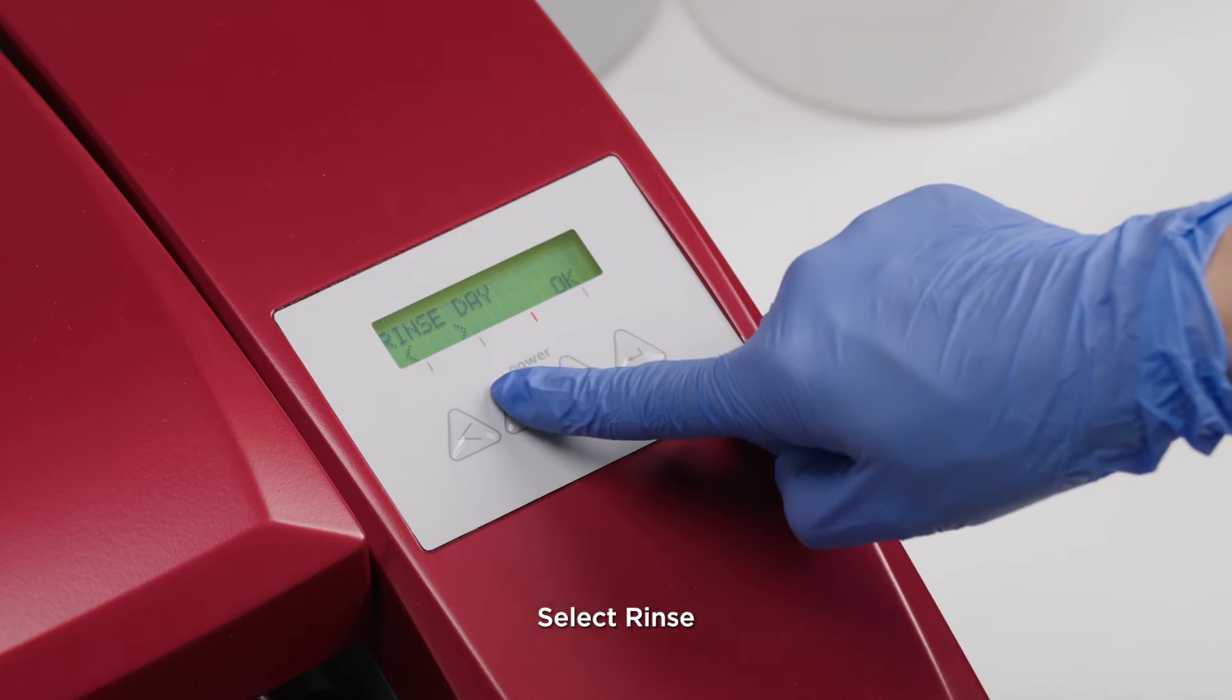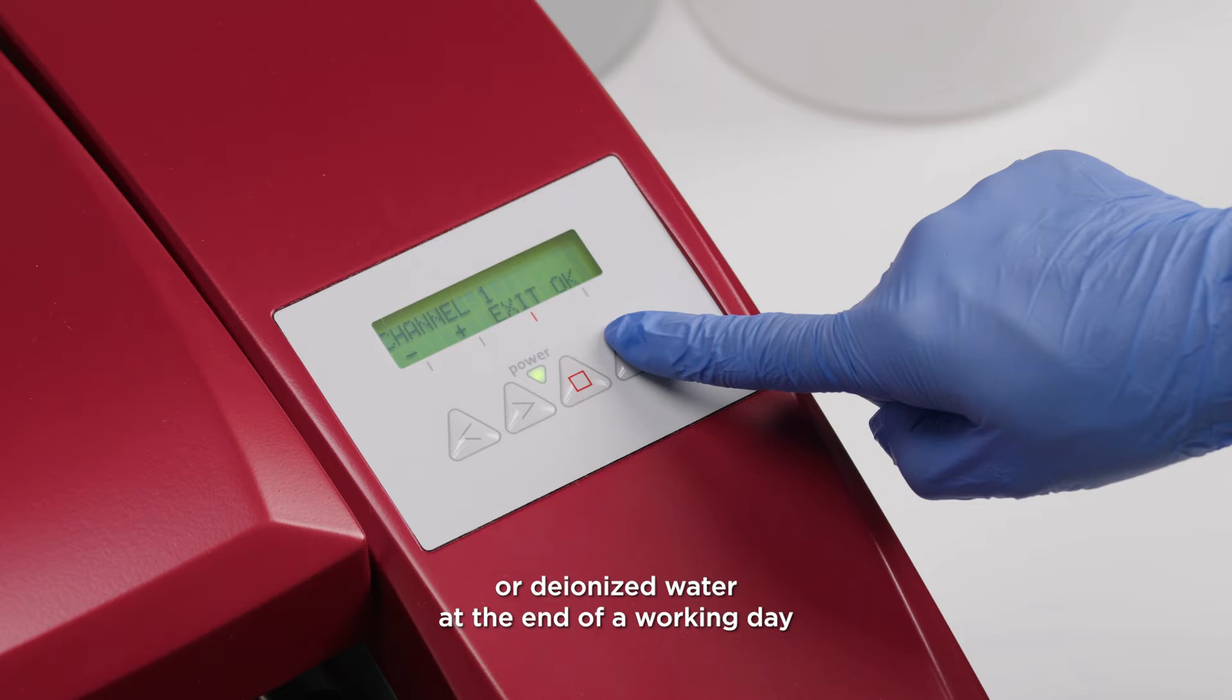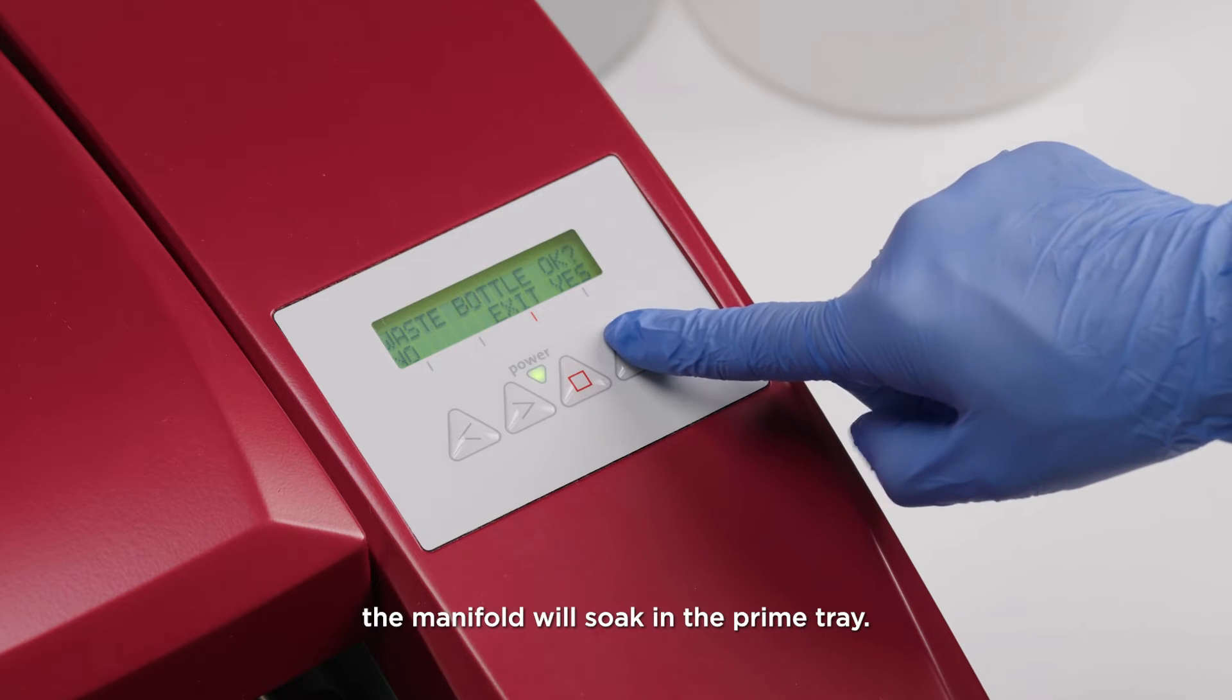Select rinse and rinse night for thorough rinsing with distilled or deionized water at the end of a working day or if the instrument will be left standing for a longer time. Select the corresponding liquid channel. The manifold will soak in the prime tray.